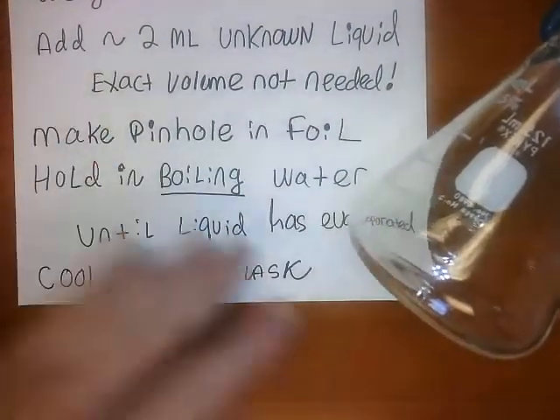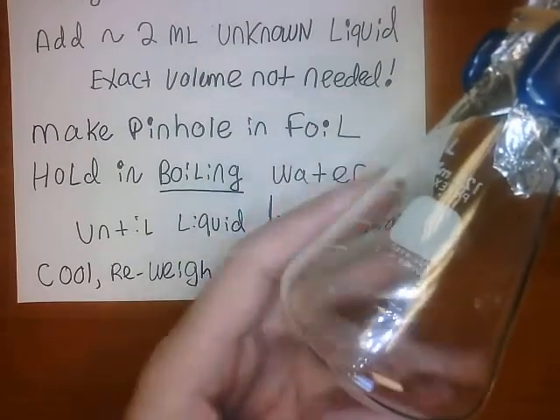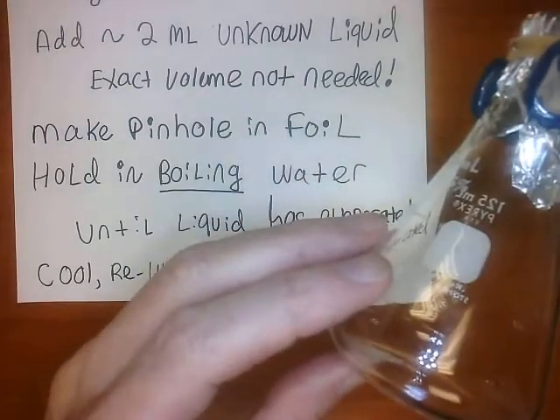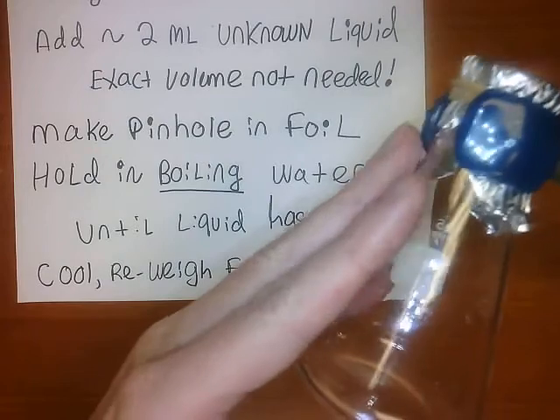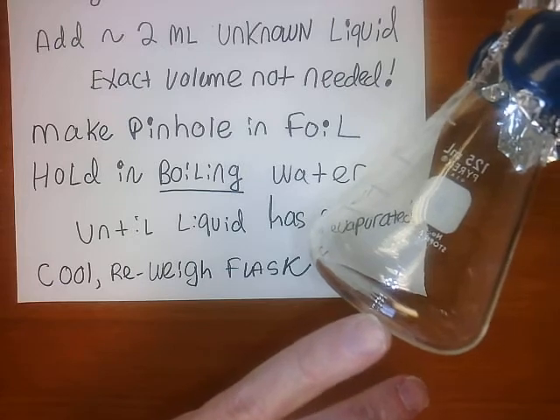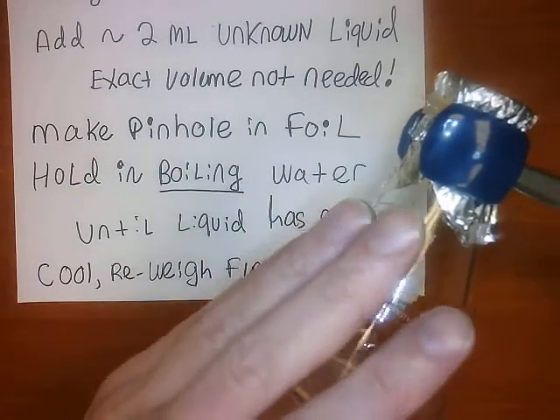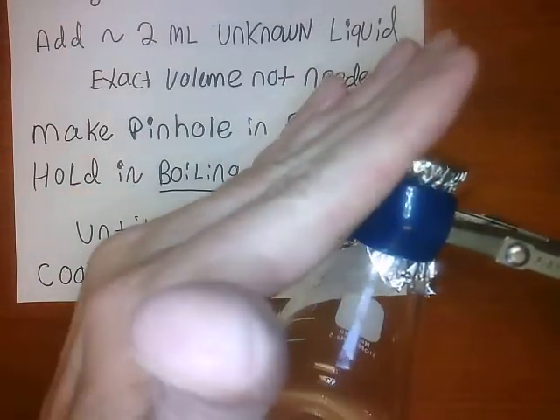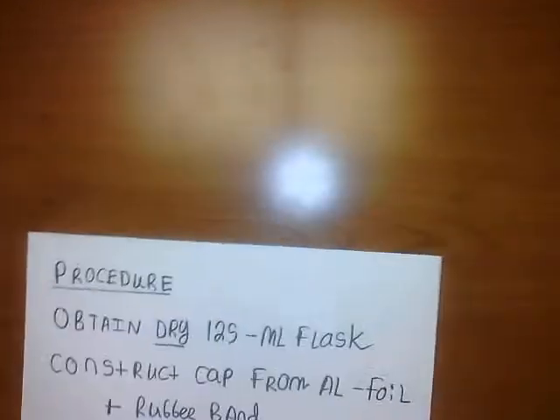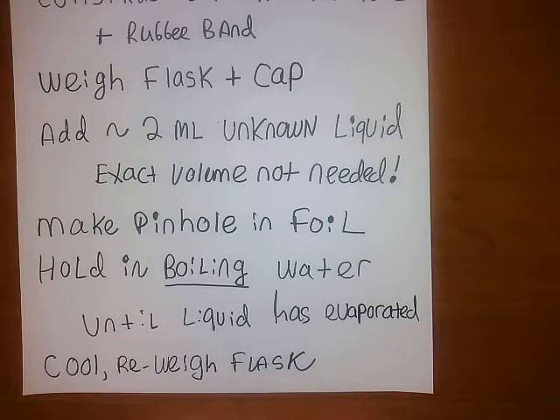You're going to cool it and re-weigh the flask. When you pull it out of the water bath and it cools off, you should see liquid condensing back down. There won't be liquid in there when you first pull it out, but as it cools, the vapor that filled the flask is going to condense. You won't have as much as you started with — not two mils — but what you will have is what was just the vapor that filled the flask, since all the excess escaped.